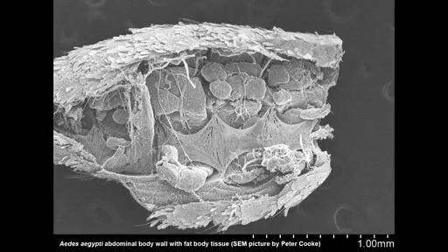The mosquito fat body culture system we will demonstrate today is an in vitro organ culture system that we use in our laboratory to study physiology and metabolism of live fat body tissue attached to the abdominal body walls of mosquitoes. Insect fat body is an organ in which many metabolic processes take place. Its functions mirror those of liver and fat tissues in vertebrates.